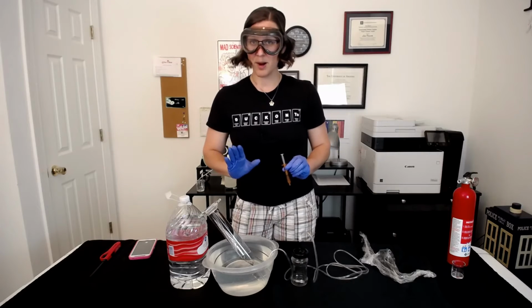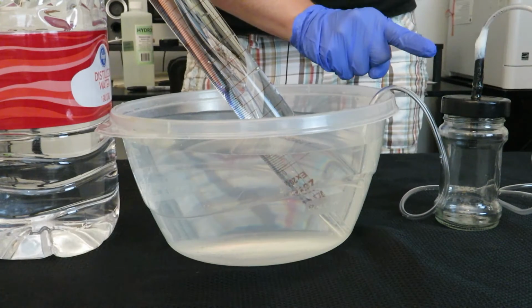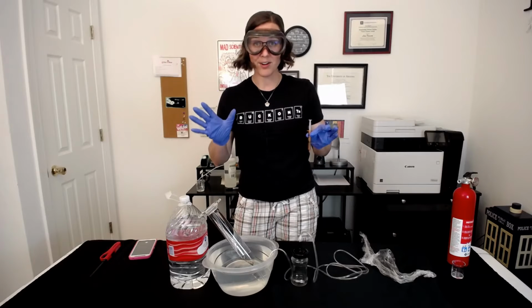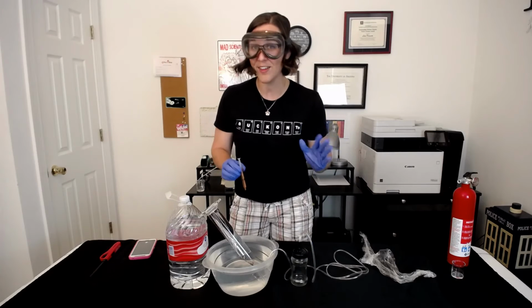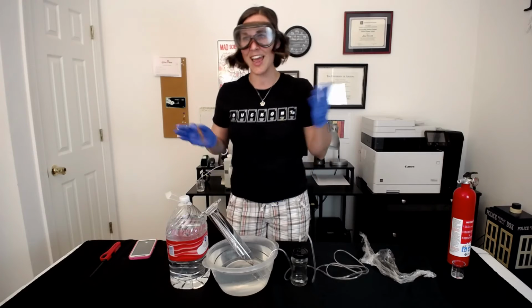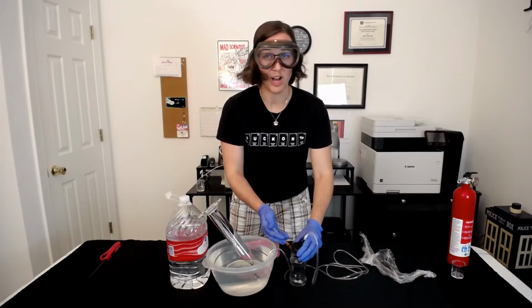Now here's the tricky part. The second that this hydrochloric acid touches that magnesium ribbon, the reaction starts immediately. So if you're working with a lab partner, it's crucial that you are getting this in the reaction vessel and sealing it as quickly as possible so that all of your hydrogen gas will actually go through the tube and into your graduated cylinder and not be wasted to the atmosphere or the room around you. Let's collect some hydrogen gas.